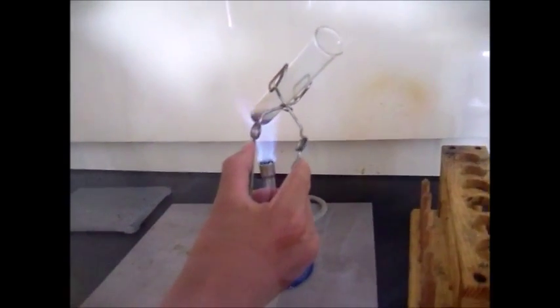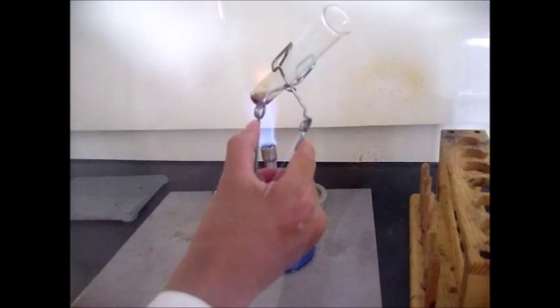So as you can see, a yellow gas is being produced, and that is sulfur.